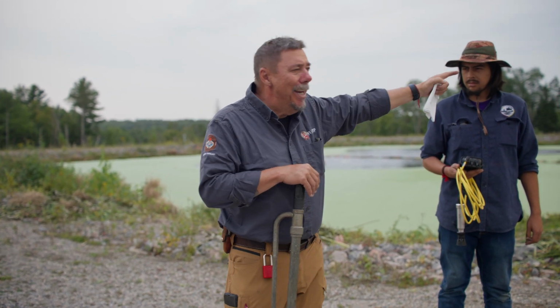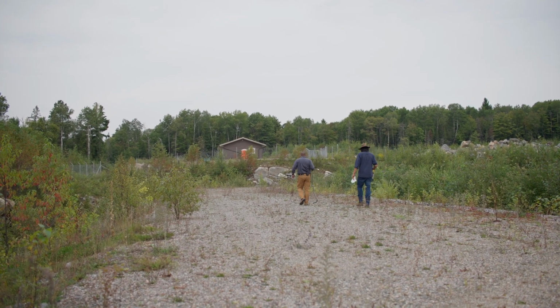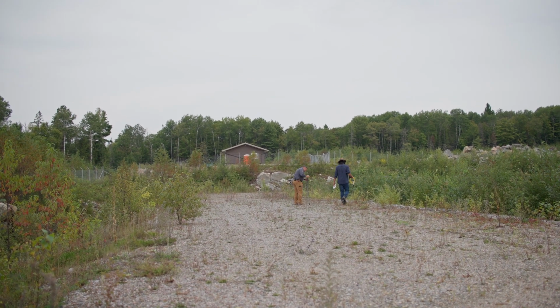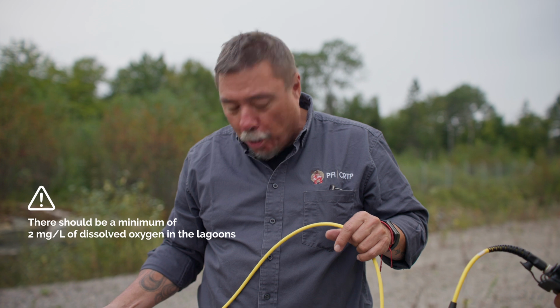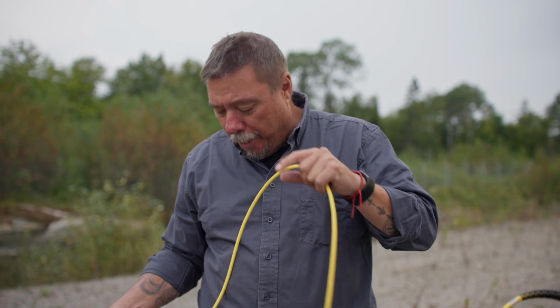So we're going to take our reading at the end of lagoon number 2 in the manhole, and then we'll come back and do the reading at the effluent of lagoon number 4. Like we said before, we have to maintain at least 2 milligrams per liter throughout the lagoons. Right now, we're at 1.24 and it's still going down a bit. And it's already stopped. So we have 1.24 milligrams per liter. That means we don't have enough oxygen going into our lagoons, so we're going to have to increase the speed of our blowers. Once we get up to 100% on one blower, if that's not enough, we can turn on another blower.